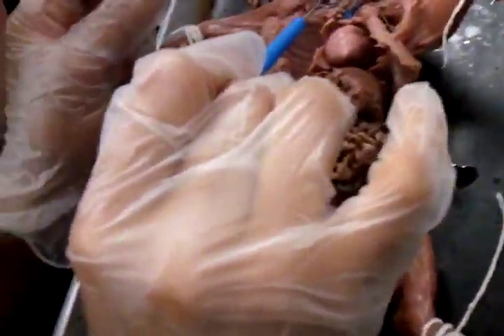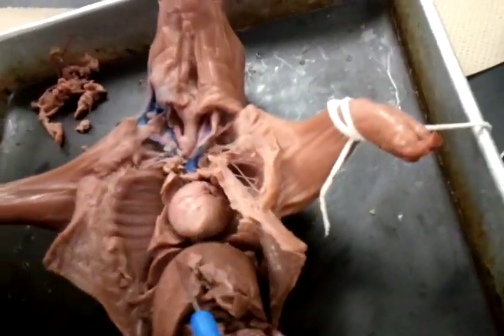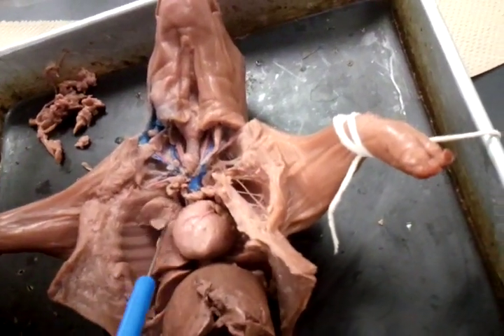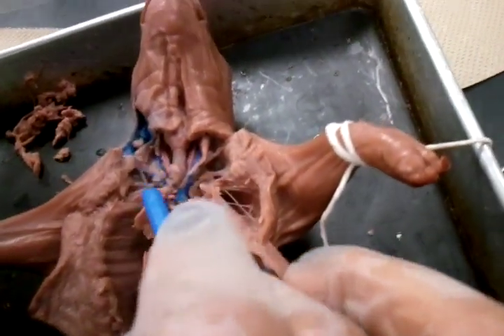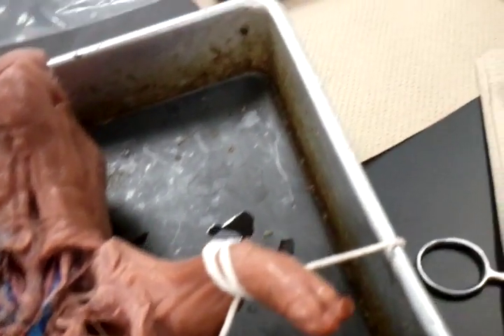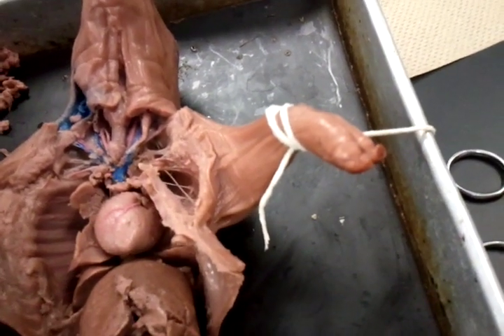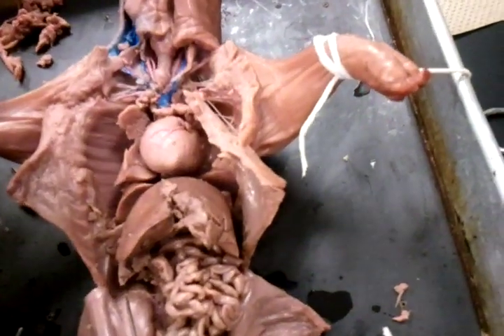The brachial — what's on the back? Oh, the iliac veins. What are the iliac veins? I remember those — oh, by the hip range, is it? Iliac — isn't that where iliac and iliac, like the bone wise? No, pelvis — those are the pelvis, some of the pelvis, right? Pancreas and all the... spleen. The pelvis, where is it? Yeah, where is the spleen and stuff? I don't know where that is. Pancreas. That's — oh, spleen.